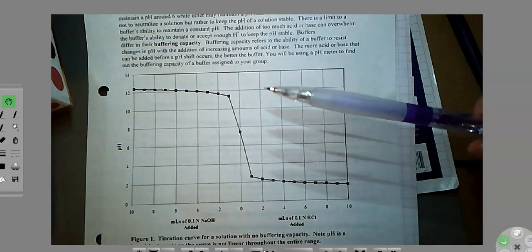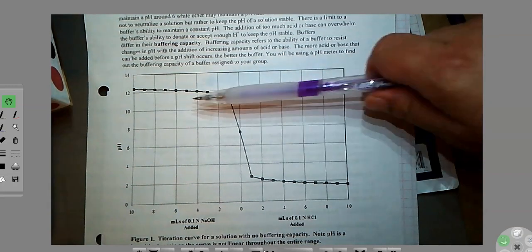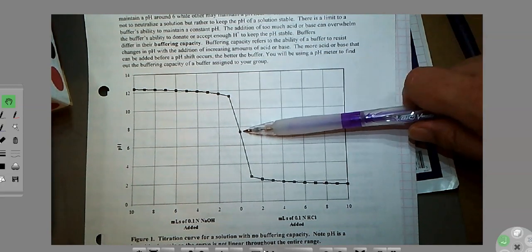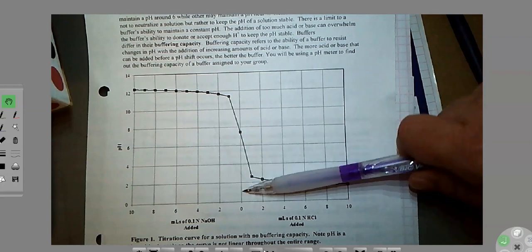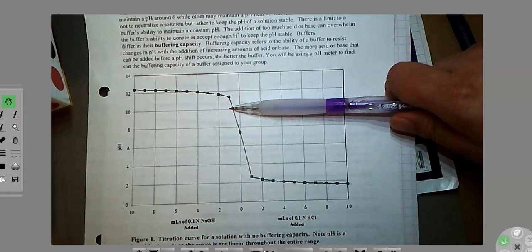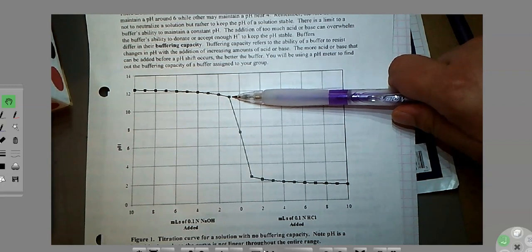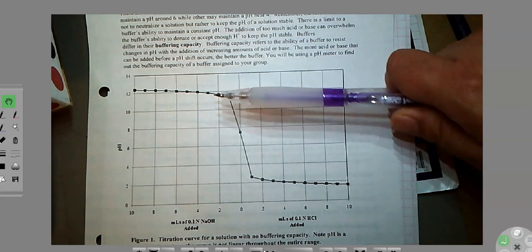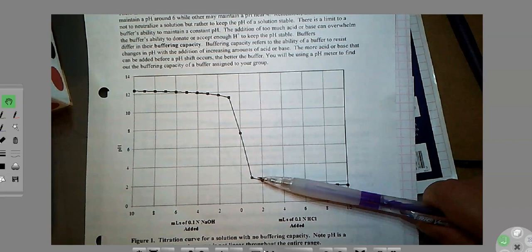Keeping that in mind, you can see that this is like water, because water's pH is 7, so here's that first data point before you add anything. As soon as you even add 1 mil of NaOH, it shoots up to 12 and then just keeps it at 12. Do you see that? And then down here, the same thing. At 0, it's just a pH of 7. But then as soon as you add 1 mil of HCl, it becomes the pH of HCl. So this is no buffering.